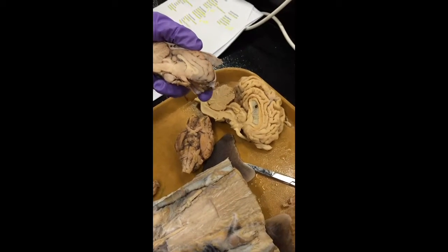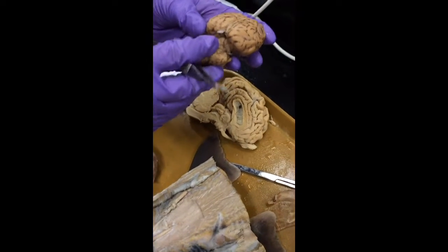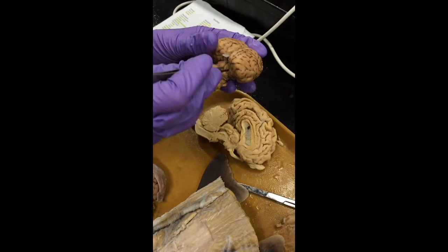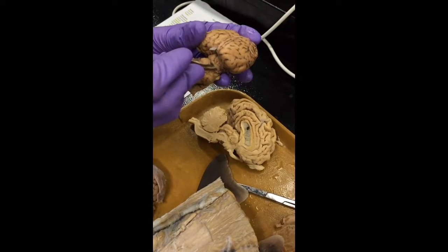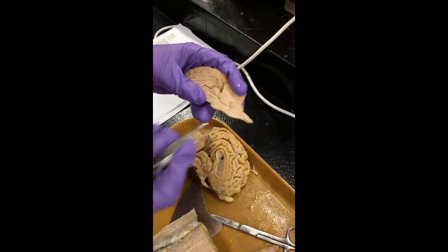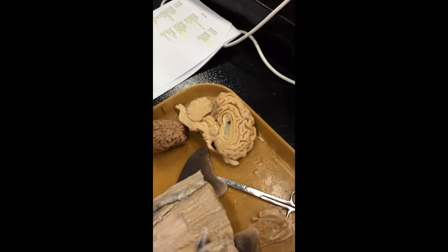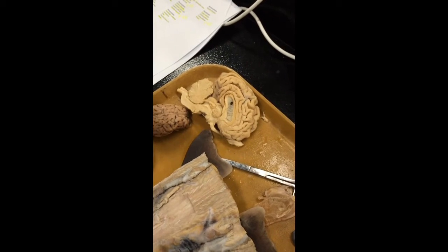Inferior and superior colliculus. Okay, if you kind of open up your cerebellum there, you can find the superior sitting above the inferior, so they're just sort of bumps. Superior colliculus, inferior colliculus. You can also see it this way. If you kind of pull back the cerebellum, superior and then inferior. So just big bumps. I think, hopefully that's everything.